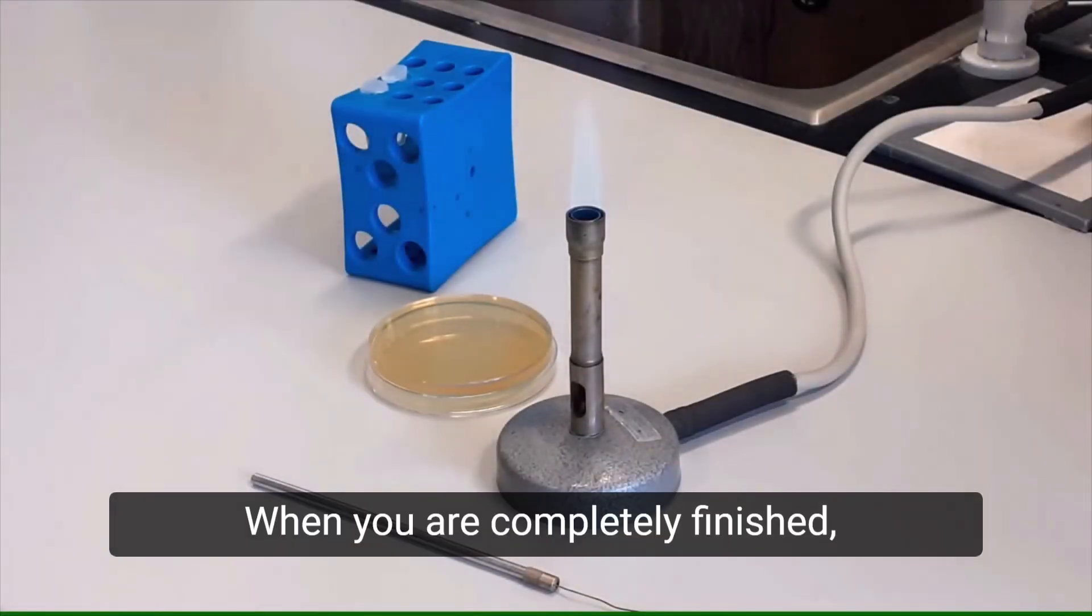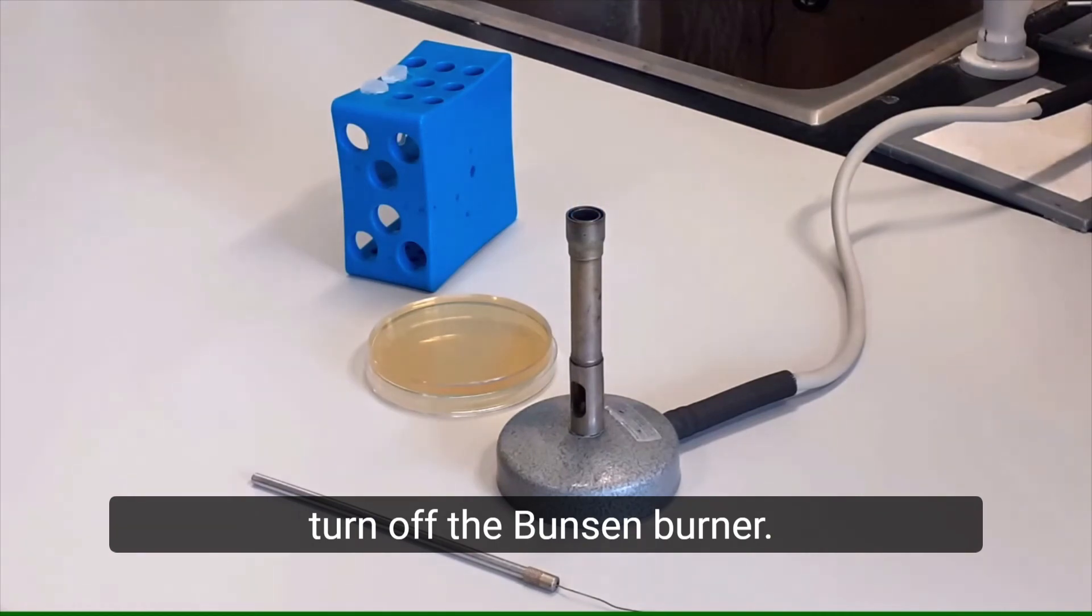When you are completely finished, turn off the Bunsen burner. Never leave a lit Bunsen unattended.